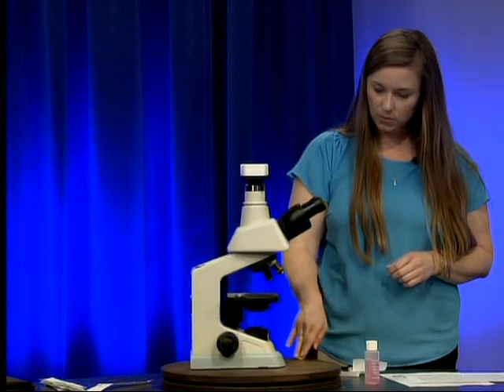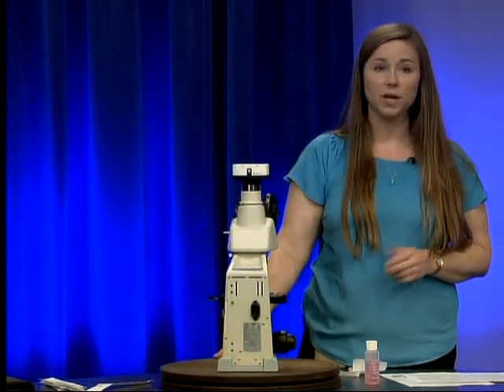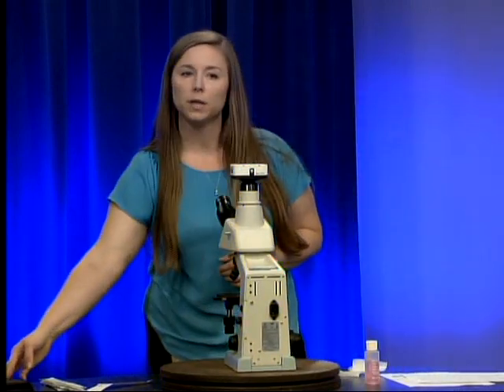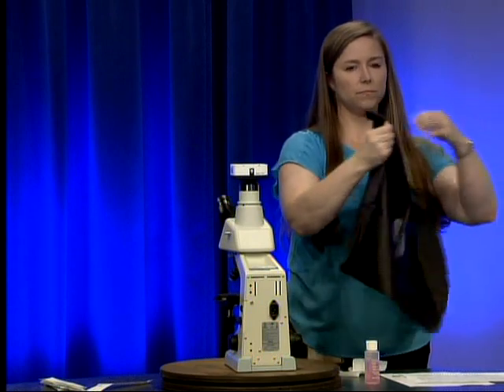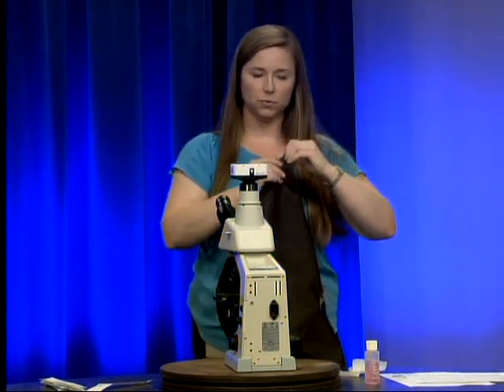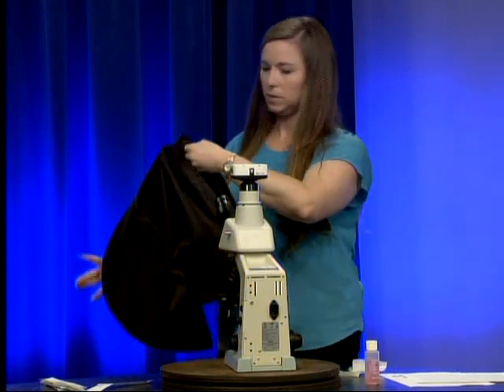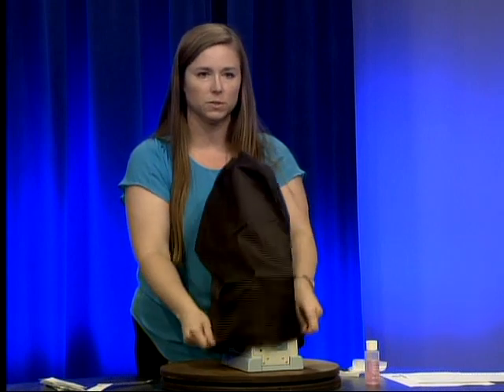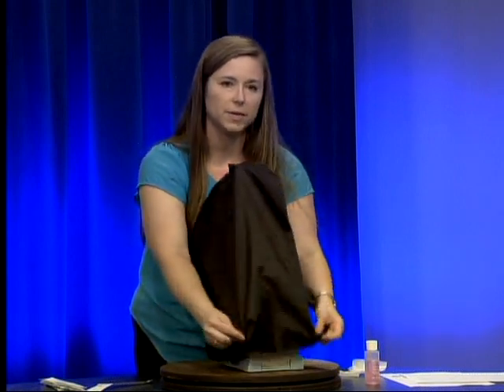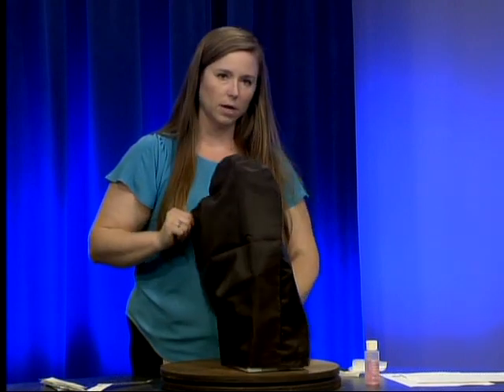One of the last things we do for daily maintenance is cover our microscope. We're going to use our nylon cover to cover the microscope for the day. This is a dust cover and it helps keep dust off our microscope, because dust is not our friend — it will get into the working parts of the microscope and gum it up.